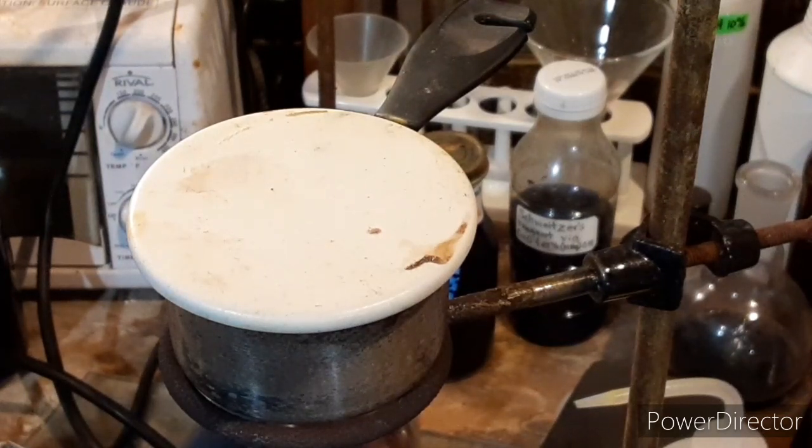What we're doing here is heating this up. You want to definitely use the anhydrous potassium ferrocyanide for this. If you don't have the anhydrous, just stick it in the oven at around 120°C for a while — you can go hotter, just stay below the decomposition point. That's how I dried mine: about 120–130°C for about an hour, and I've had this dried for about a year.